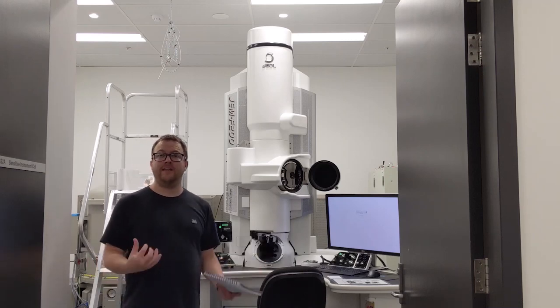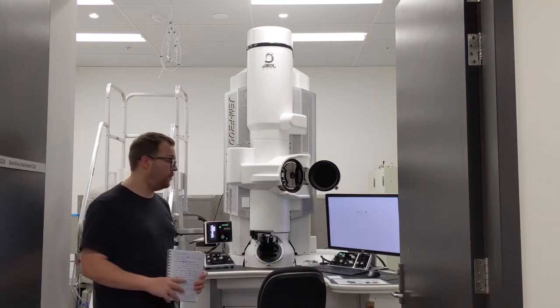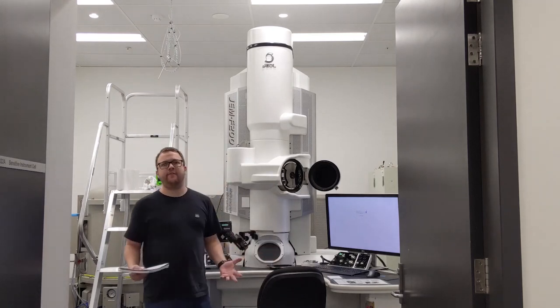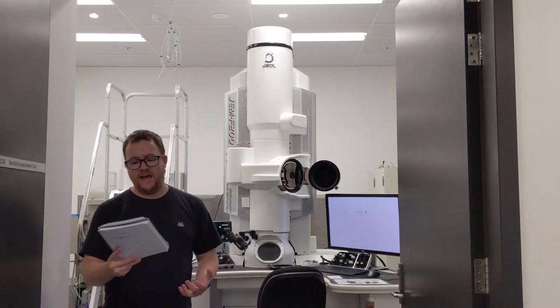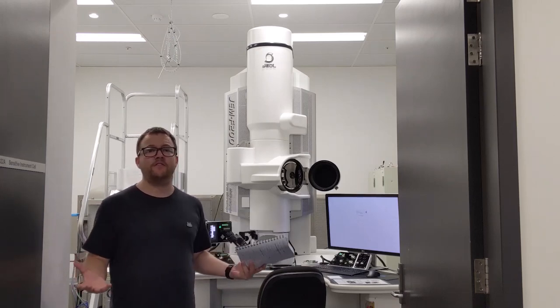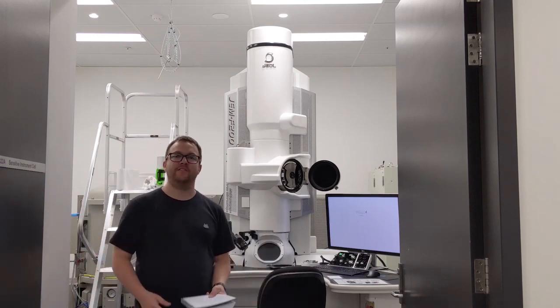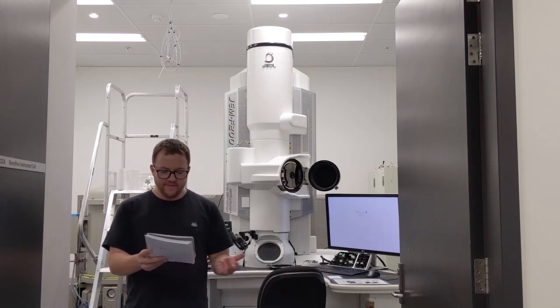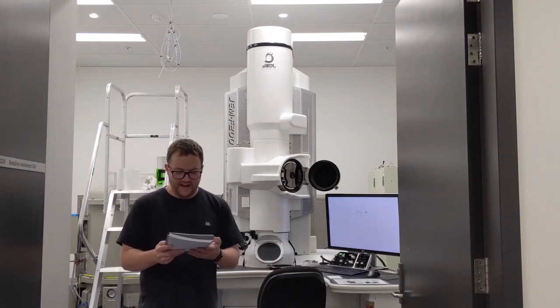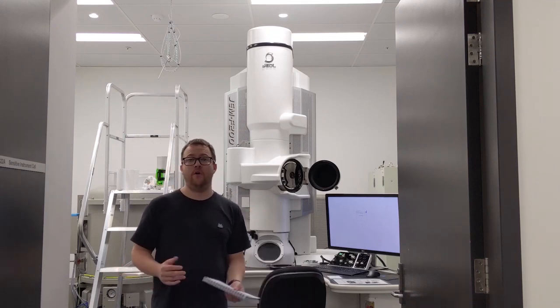Finally, we need some way of detecting the electrons. We have two main detectors in this microscope. Firstly, we have a fluorescent screen, which is mainly used for the initial alignment of the microscope and looking at the image with our eyes — where the electrons hit it, we see bright areas, and where they don't, we see dark areas. Then we also have a digital camera below the screen, and we can view that on the PC screen and record these images for further analysis.